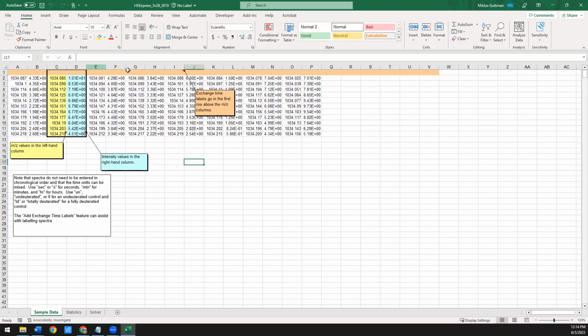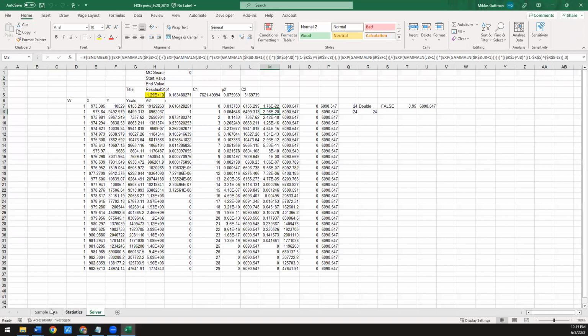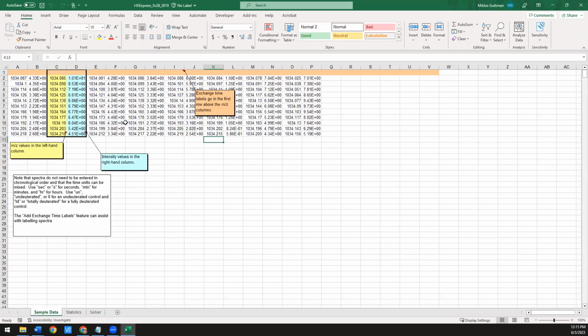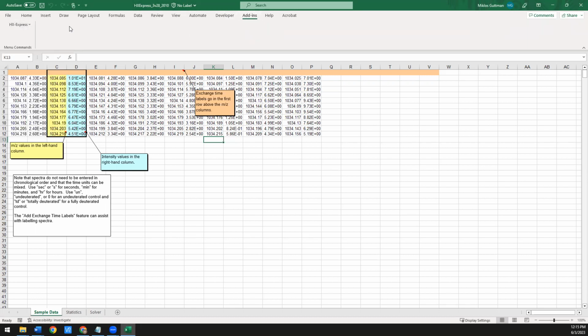Once you are in that HXExpress worksheet, you'll see that this is the main sheet. This just has examples of what the data format will need to be that you import to process. You don't actually have to edit anything within this workbook though. So there's a sample data, there's statistics, and there's solver. None of this you ever have to mess with. So just leave that as is. But as soon as you open this workbook, you'll see that an add-in pops up here, and this is what gives you access to all the functionalities of HXExpress.